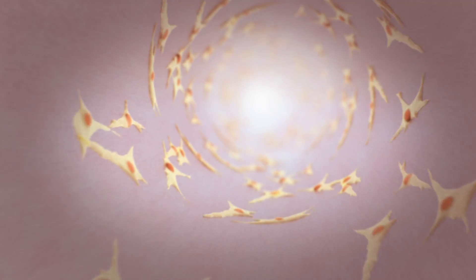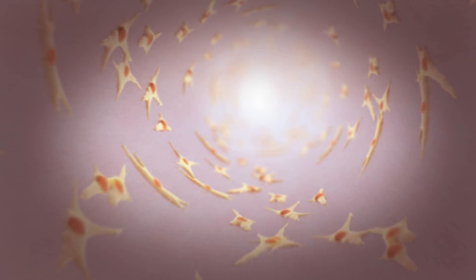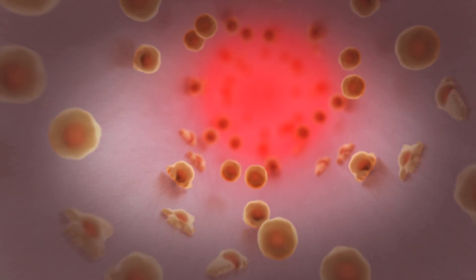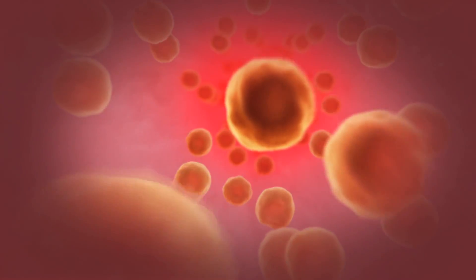After cell expansion, harvest is a rapid process. Cells are released from the hollow fibre walls into suspension and collected. Harvest is complete within minutes.